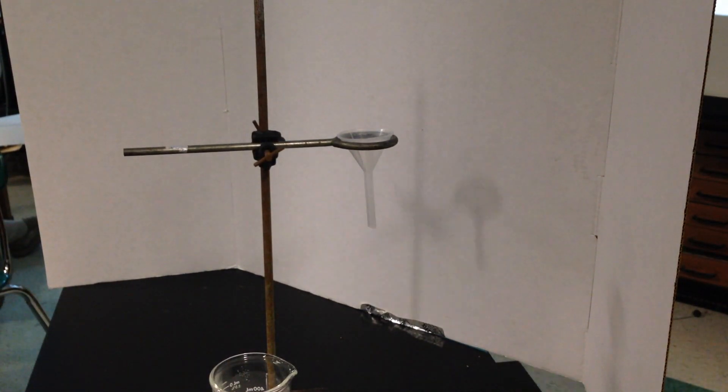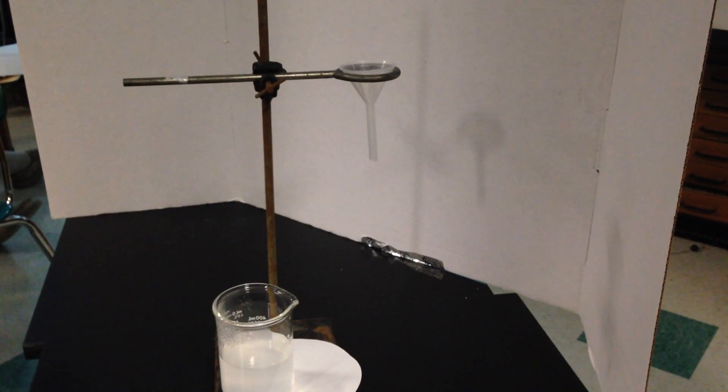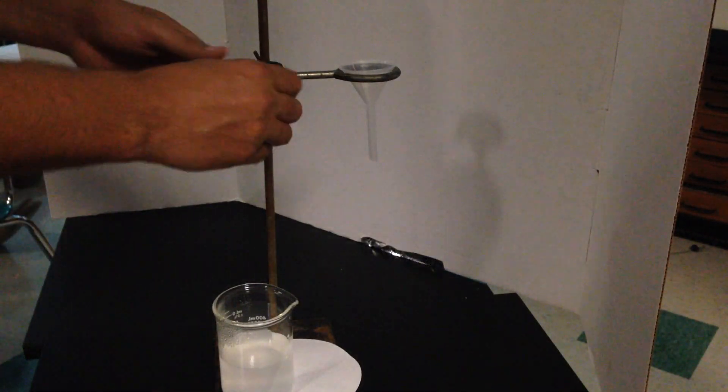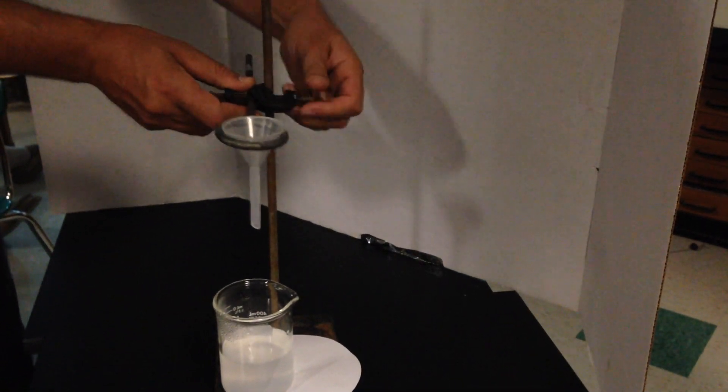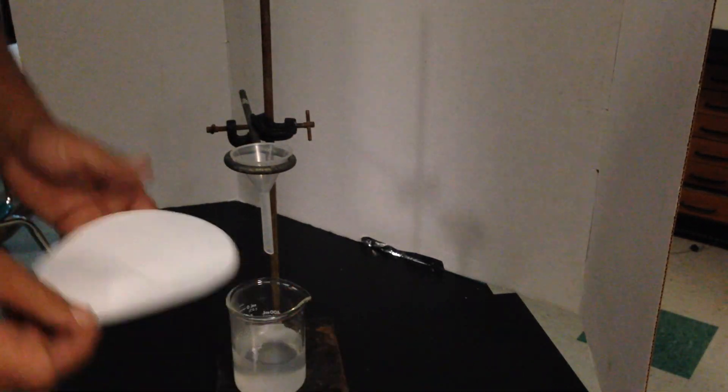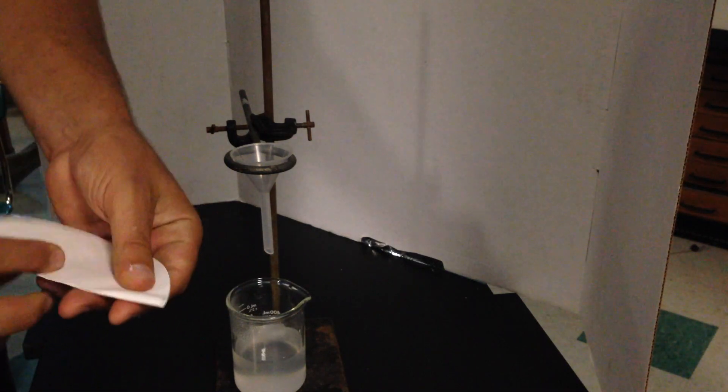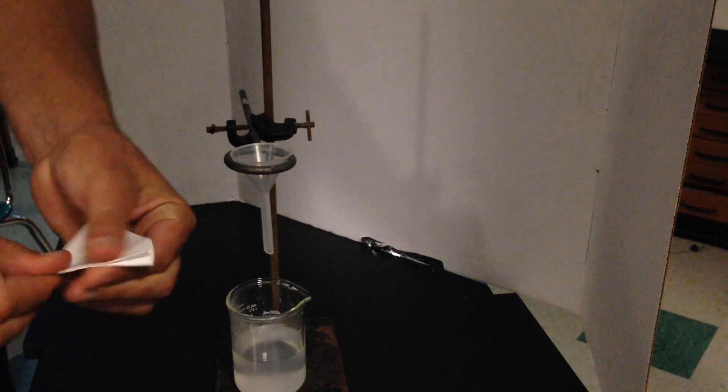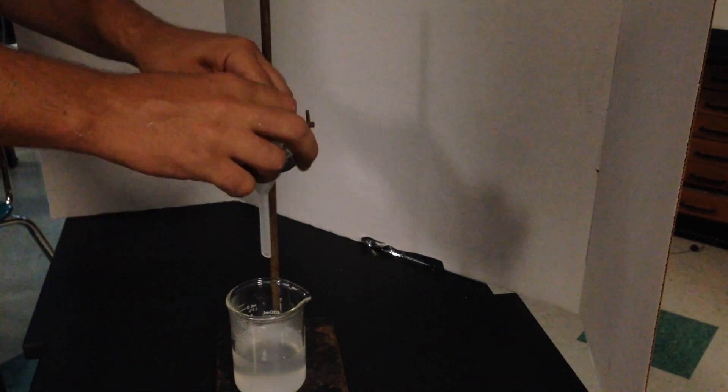There's my water, and I'm going to perform a hot filtration. It sounds like a new dance move. Here's my filter paper. I'm going to take a piece of filter paper. As you've probably done in some labs, I'm going to fold it over once, fold it over tight. Sometimes they rip the ends to know which side is which. I put the filter paper in here, open one end up.